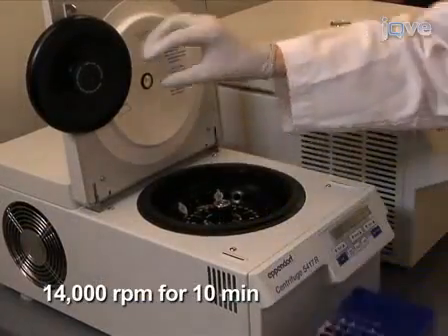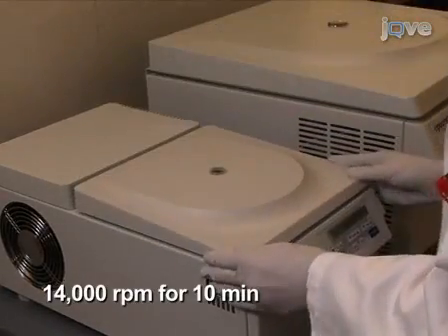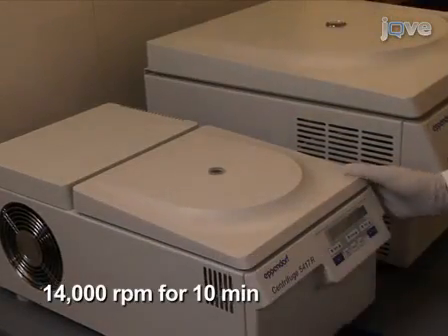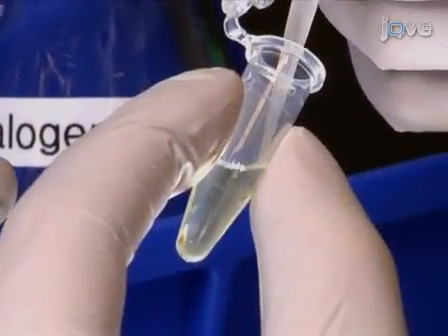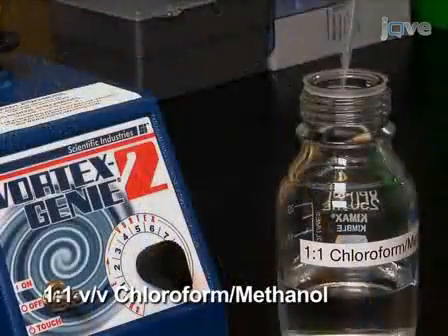Centrifuge the sample at 14,000 rpm for 10 minutes to pellet the alcohol-insoluble residue representing the cell wall material. Carefully aspirate the supernatant, making sure not to disturb the pellet.